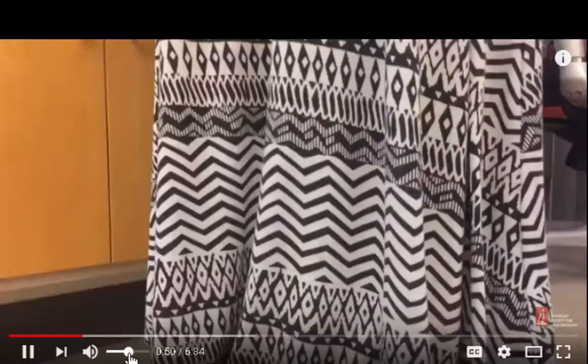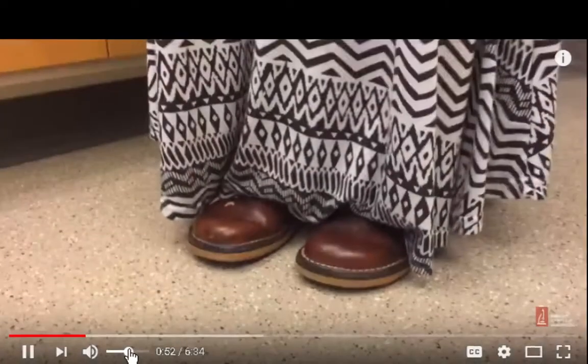Here we are in my lab. Before we start, we should suit up. You have to wear a lab coat, protective eye gear, and gloves. Make sure to have no open-toed shoes. For a complete set of rules, please visit ASM's website.